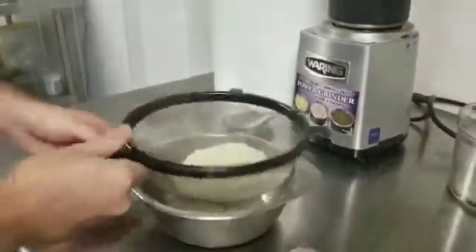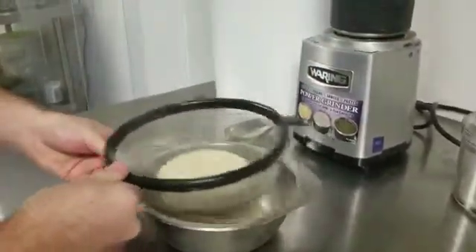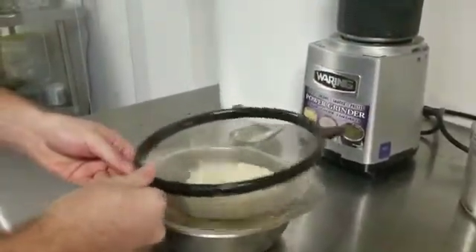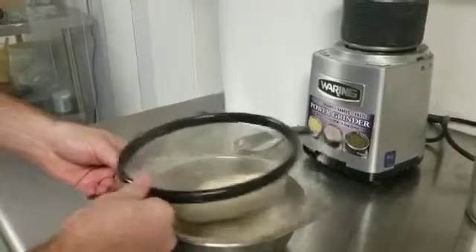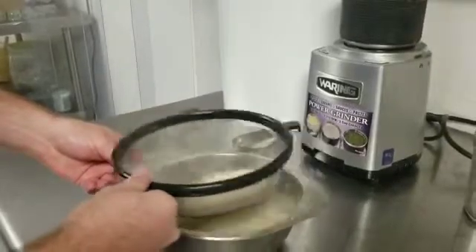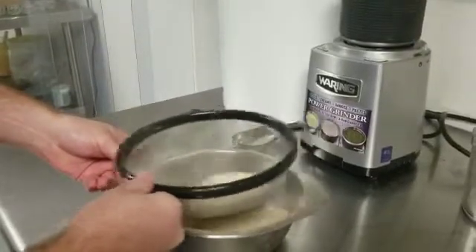We're going to sift this so that the bigger particles don't throw any kind of noise into the system, and we standardize this practice for all samples.